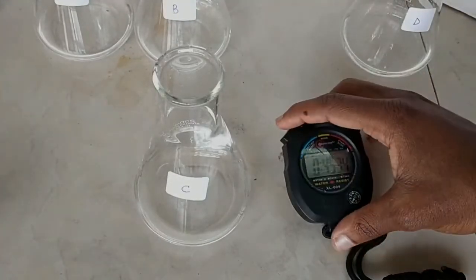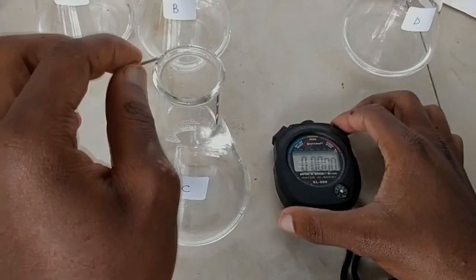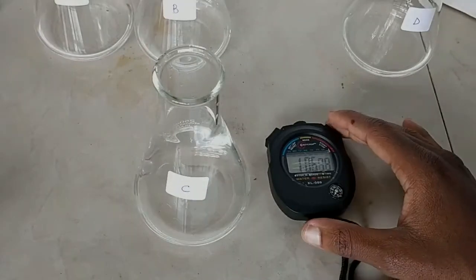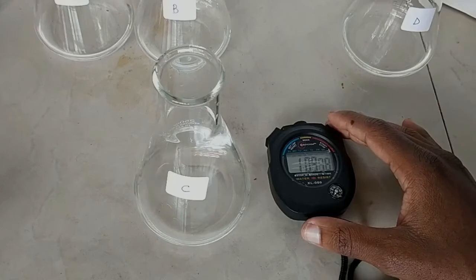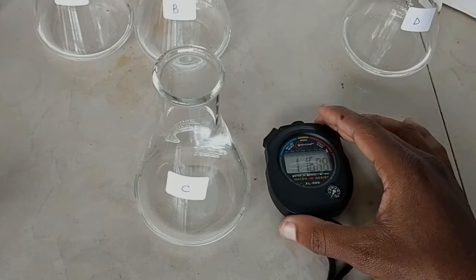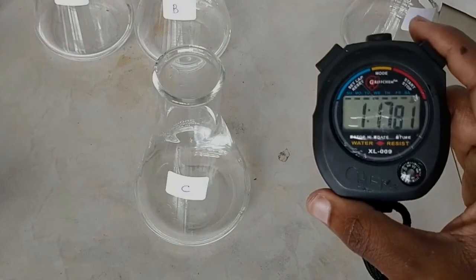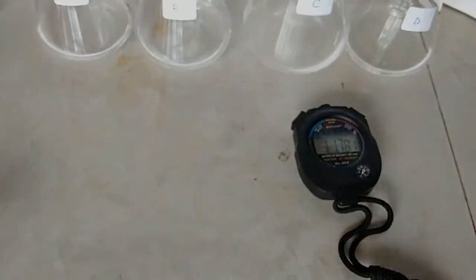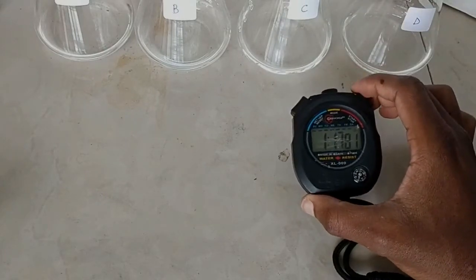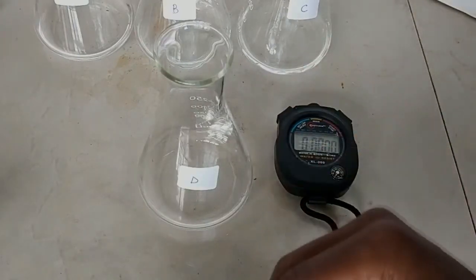Now I'm on to flask C. I reset my stopwatch and put in another 2 centimeter magnesium ribbon. Almost the final bubble there — that is one minute and 17 seconds. What you need to do is convert this into seconds: 60 for one minute plus 17 gives you 77 seconds.